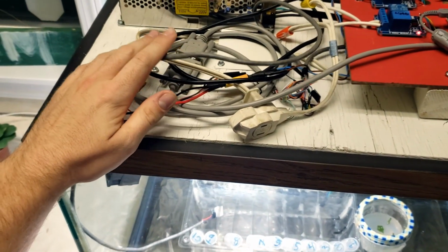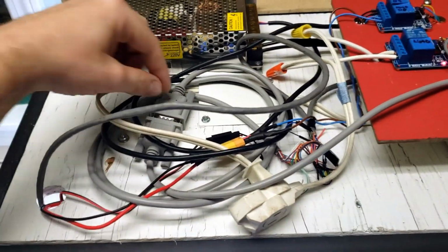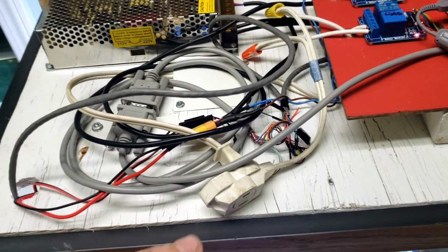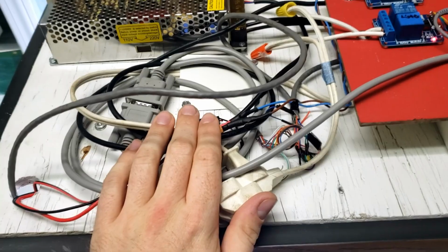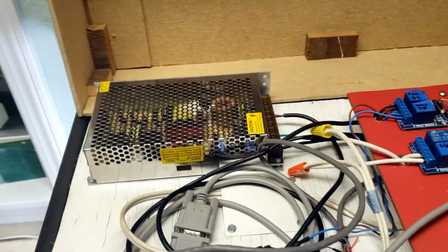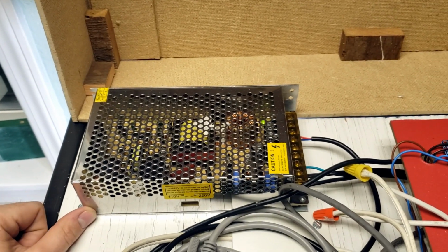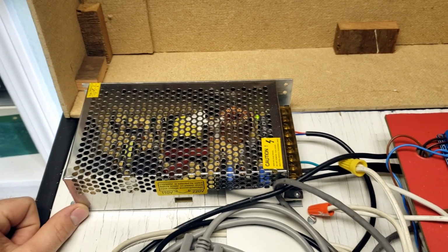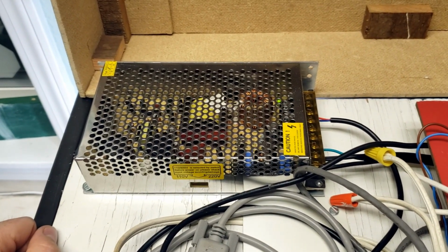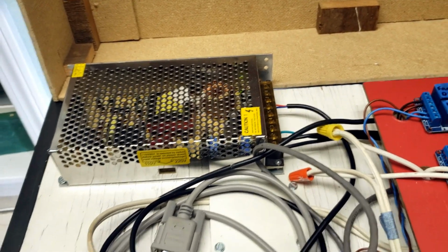And that's why I have this big ball of wires here. Everything is detachable, the power is detachable, the control cable is detachable. So that's why it looks like it might be a bit messy, but that was all done on purpose to give me some extra slack and if I want to use this in a different project later on. So let's get into it. This is the DC power supply that provides 24 volts, 10 amp DC current. And I know that sounds like a lot, but that heater down there is very power hungry. So we need to have a hefty heater for it, or a hefty power supply for it.